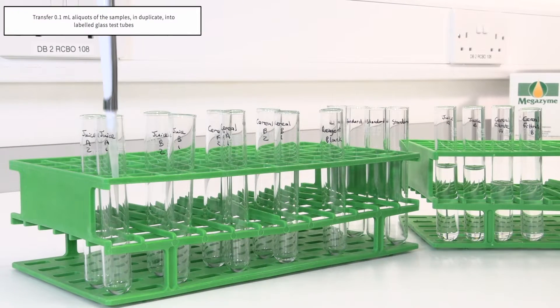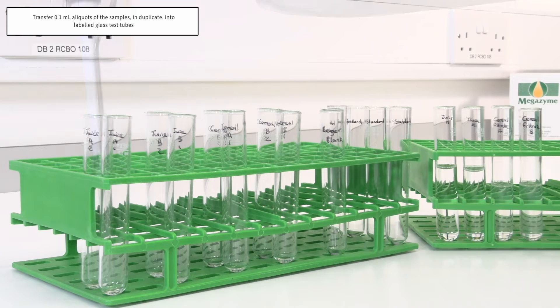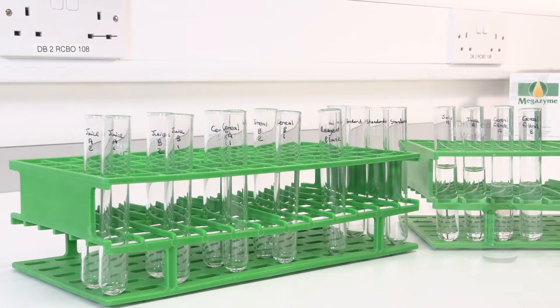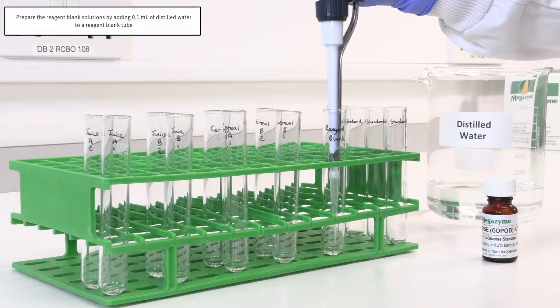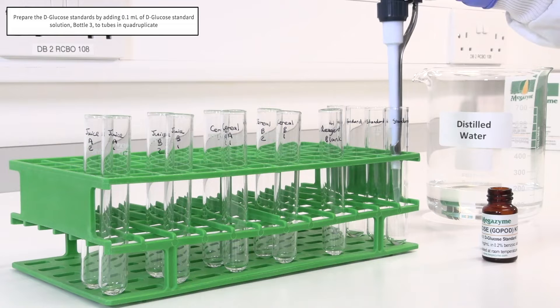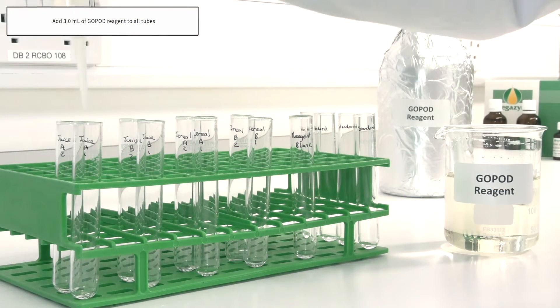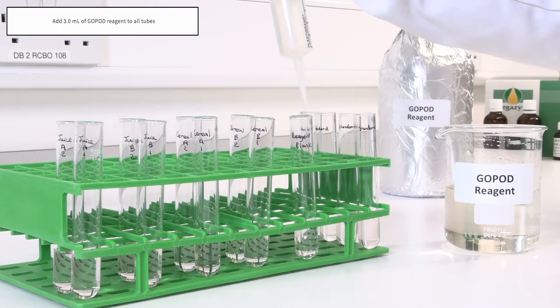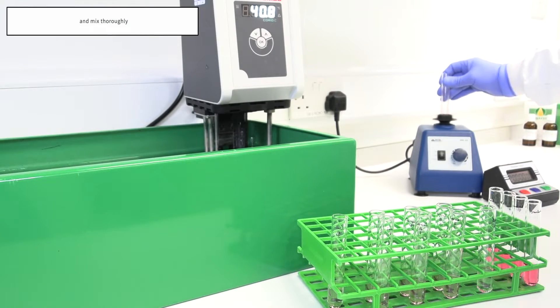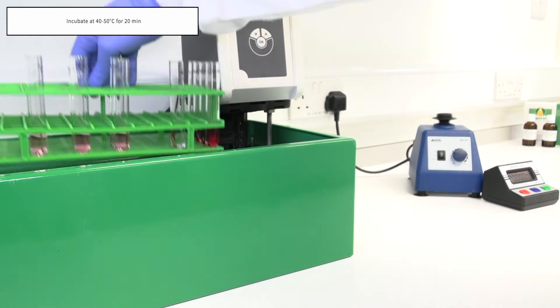Follow the assay procedure as described in the assay protocol. Transfer 0.1 ml aliquots of the samples in duplicate into labelled glass test tubes. Prepare the reagent blank solutions by adding 0.1 ml of distilled water to a reagent blank tube. Prepare the D-glucose standards by adding 0.1 ml of D-glucose standard solution Bottle 3 to tubes in quadruplicate. Add 3 ml of GOPOD reagent to all tubes including all samples, blanks and standards, and mix thoroughly. Incubate at 40 to 50 degrees Celsius for 20 minutes.